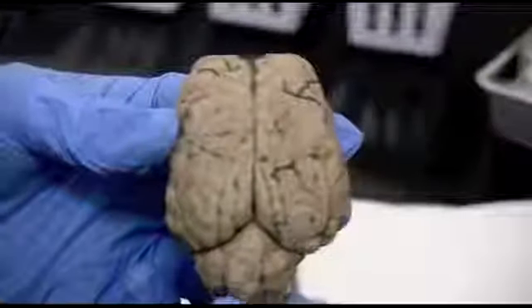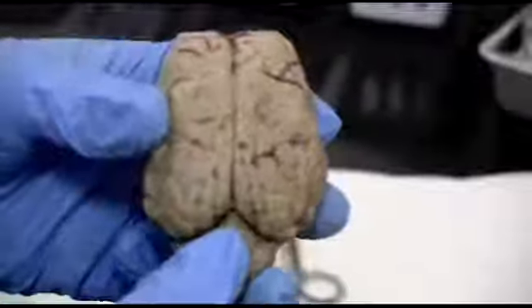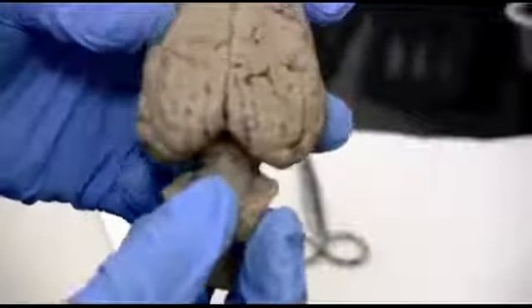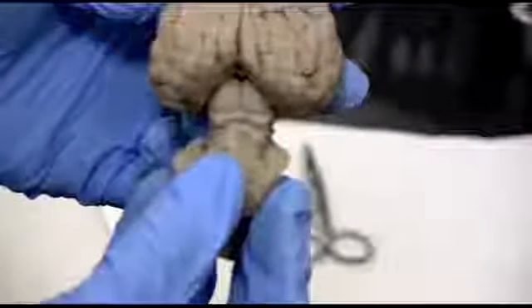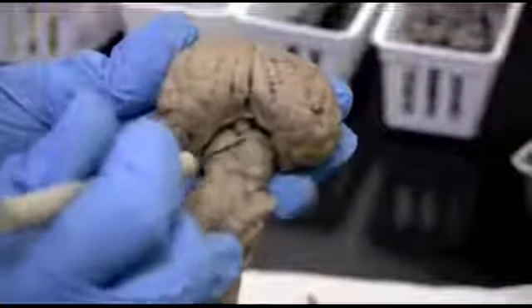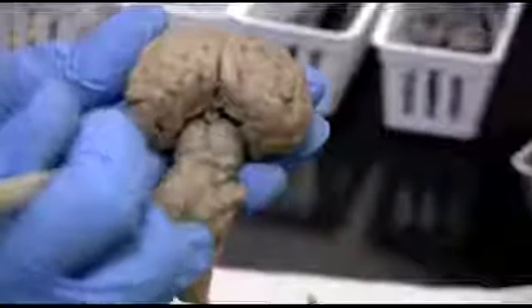Okay, and we're back on the superior side of the brain. Just want to show you what happens when we pull back and separate the cerebellum. That's not a natural thing. You actually have to do that on purpose. If you look inside here, we have 4 bumps that you can see right here. This is part of the mesencephalon, the middle brain, midbrain.